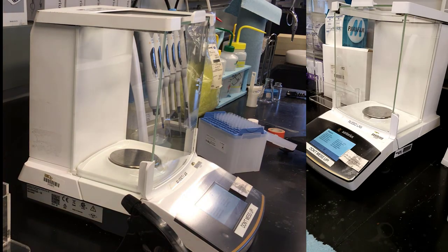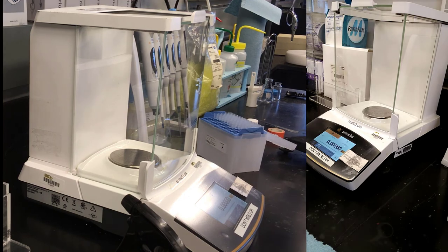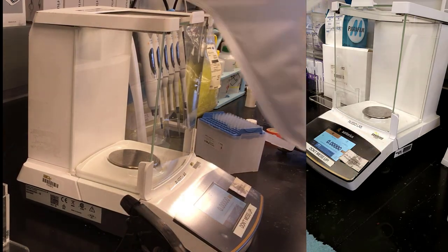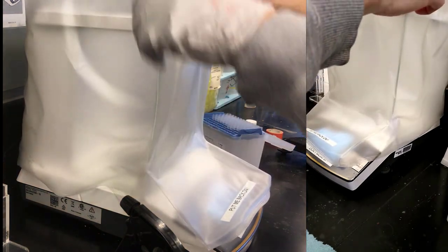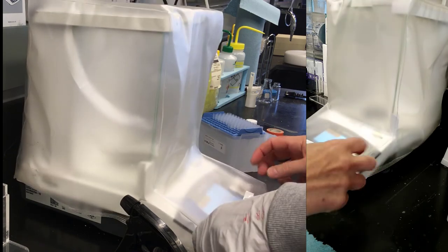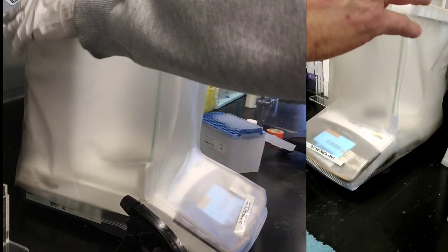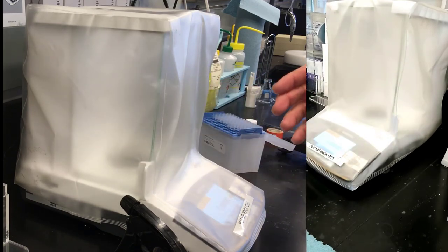Okay, so there's one more thing that's very important to do at this point. I guess you can accept this by hitting close on that window. And then, very, very important, put its cover back on. You know, all sorts of disasters happen in the lab. Somebody's walking and they trip and they throw a bottle of solvent up in the air. And this is designed to protect against that kind of disaster.